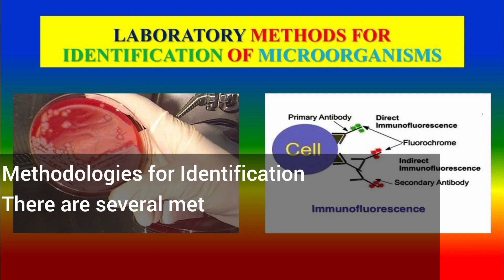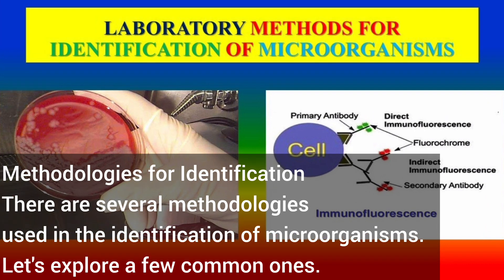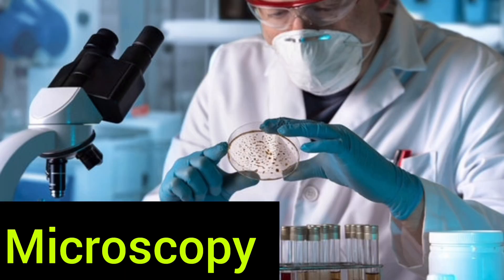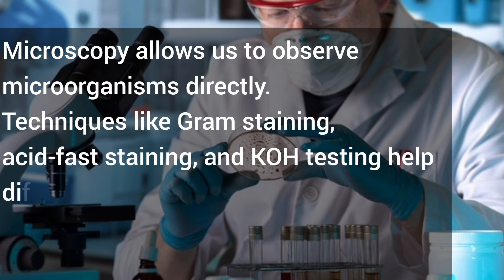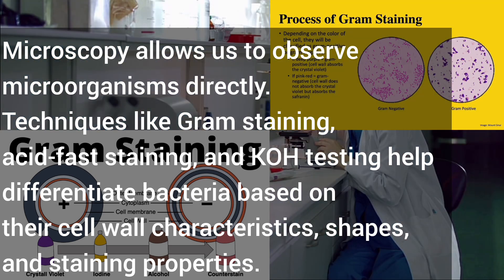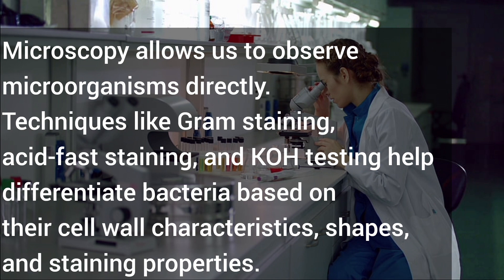Methodologies for identification. There are several methodologies used in the identification of microorganisms. Let's explore a few common ones. Number 1: Microscopy. Microscopy allows us to observe microorganisms directly. Techniques like gram staining, acid-fast staining, and KOH testing help differentiate bacteria based on their cell wall characteristics, shapes, and staining properties.